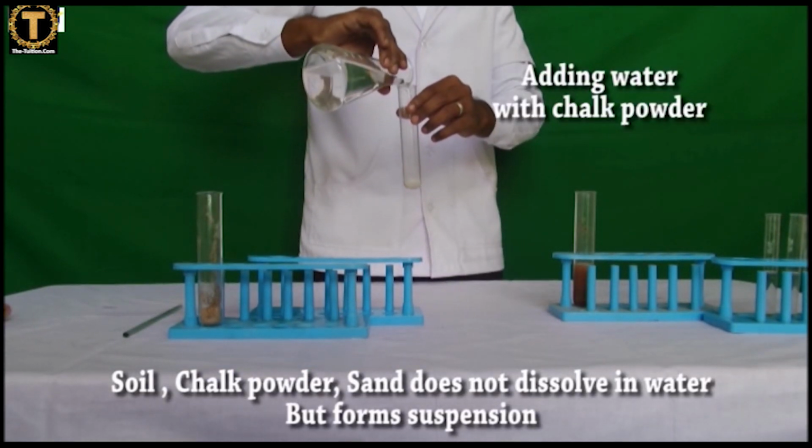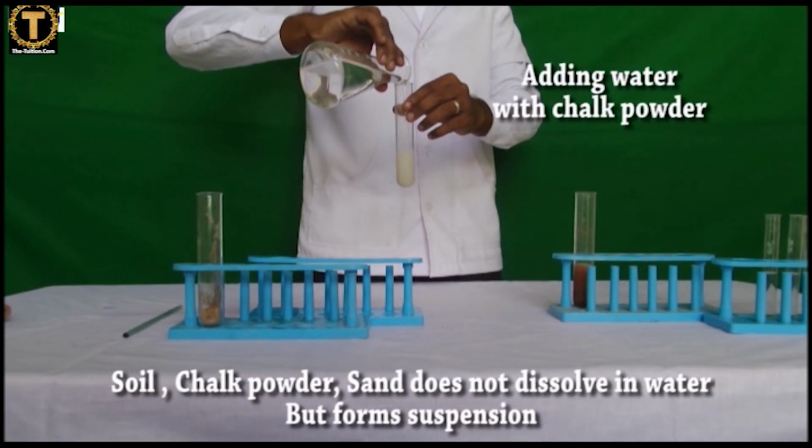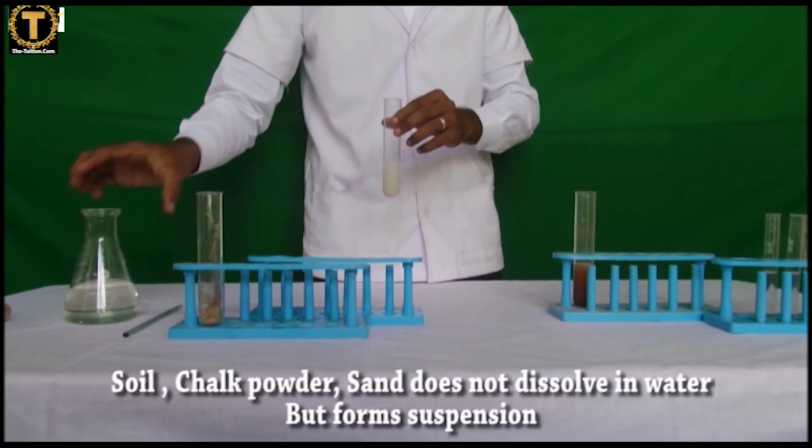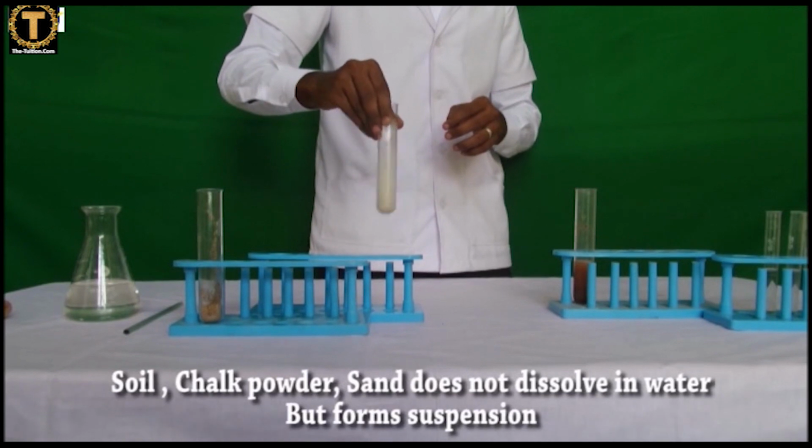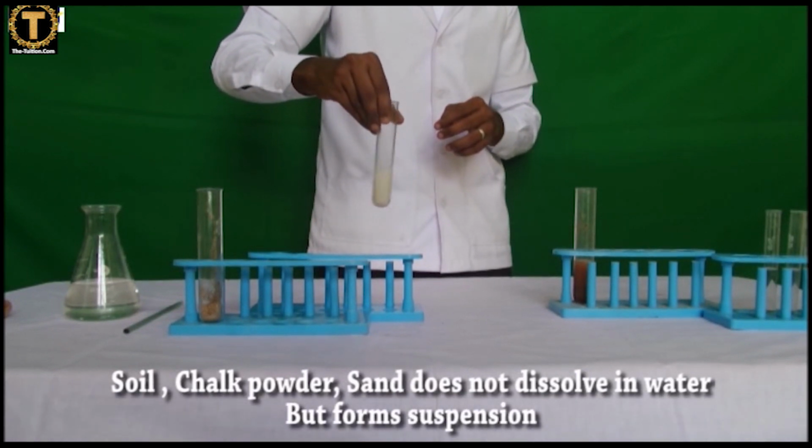Suspension of chalk powder in water. Take 2 to 5 ml of distilled water in a test tube, add a pinch of chalk powder in it, stir well and record your observation.